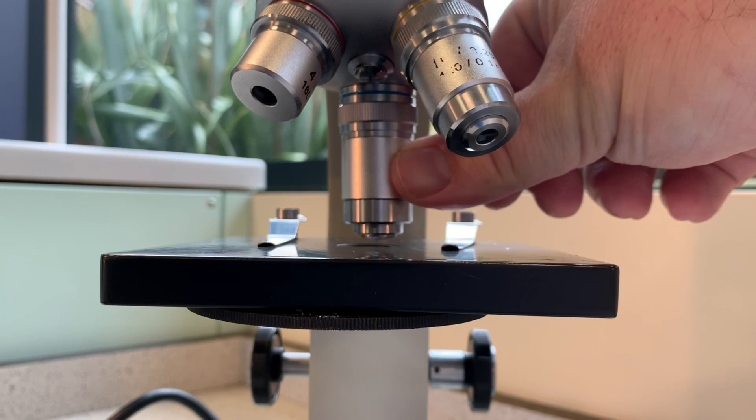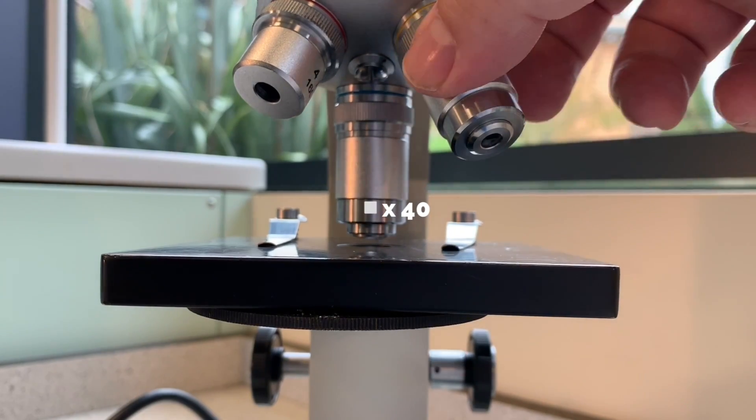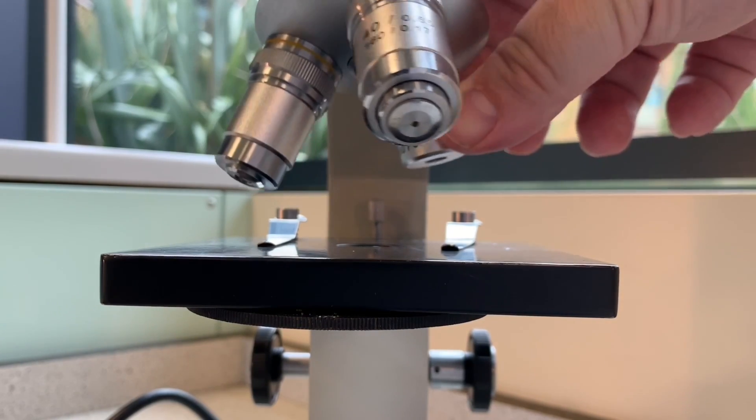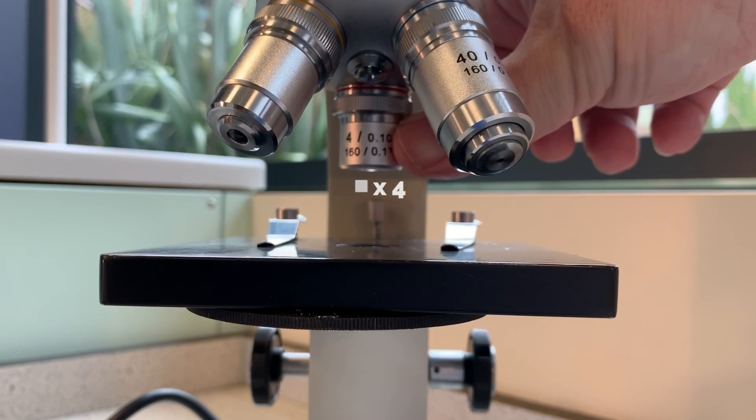This microscope has three objective lenses: 40x magnification, 10x magnification, and 4x magnification.